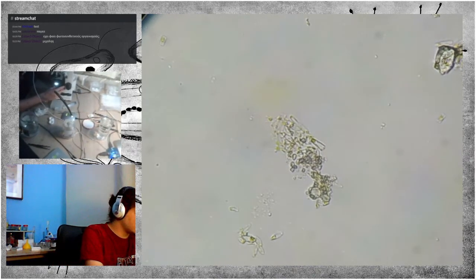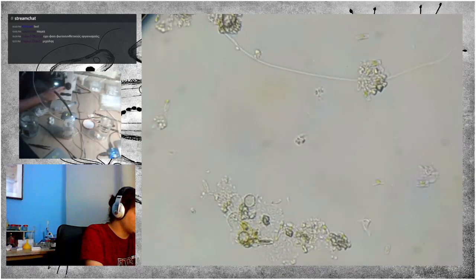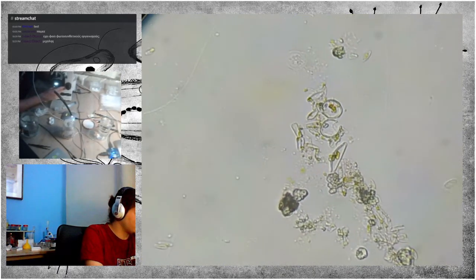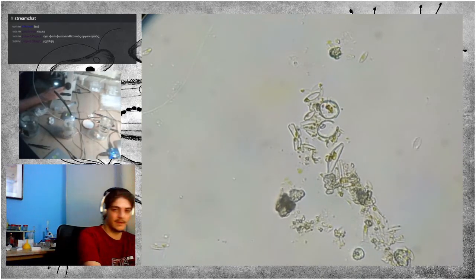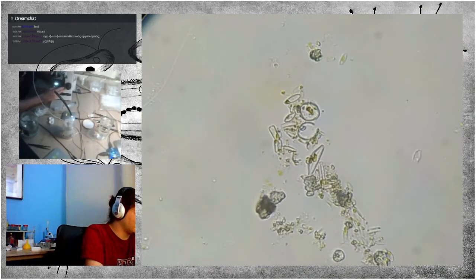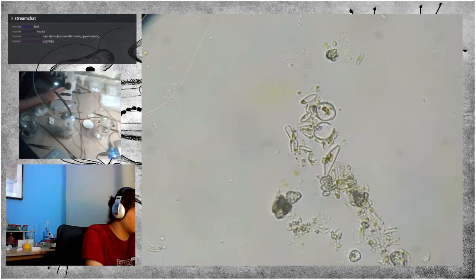The shells, as they're made of silica, stay well after the death of the diatom. Here also you can see the shells of some bigger diatoms. You can also see that the middle one, the oval shell, is broken, which could mean that it was eaten before it died.